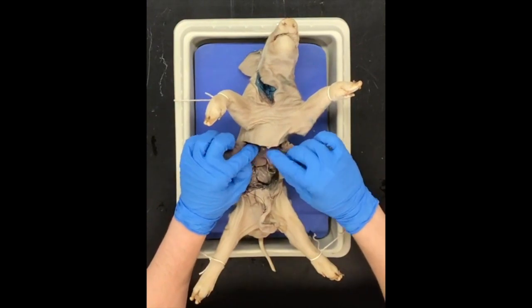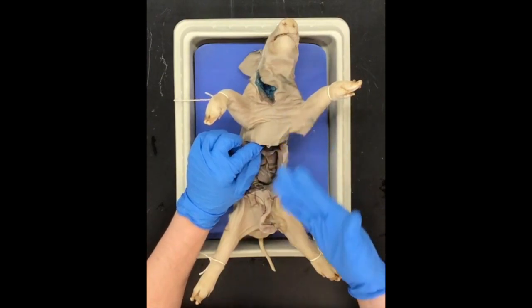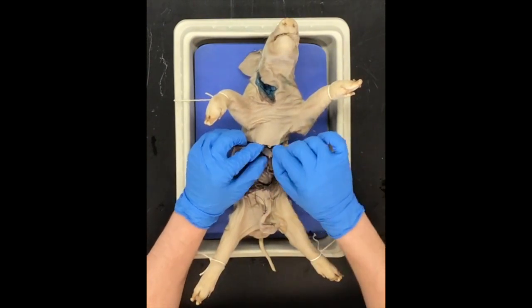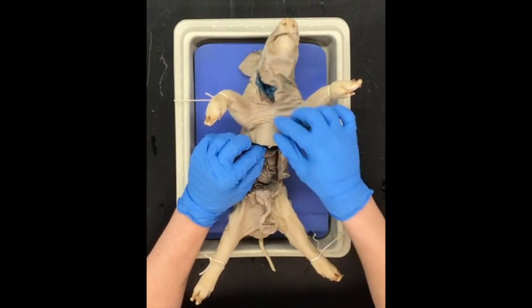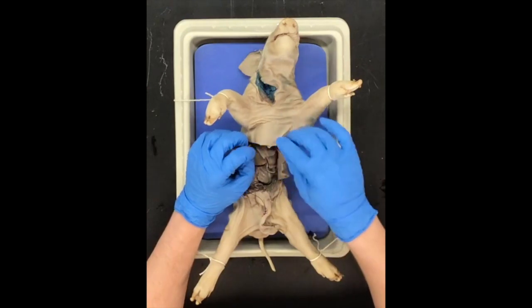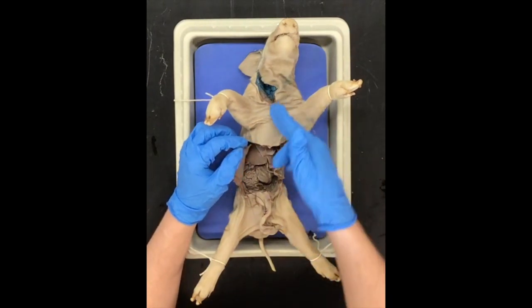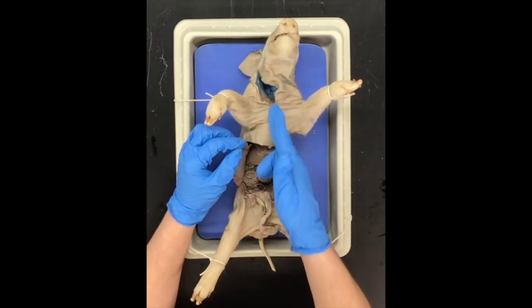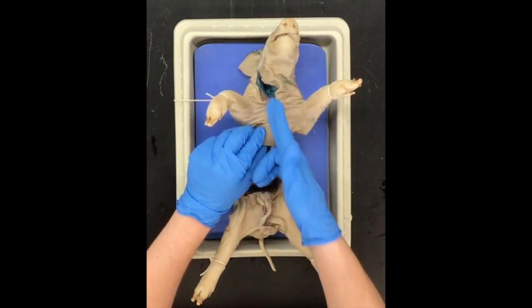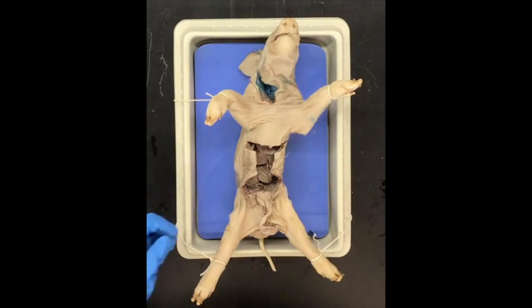This flap right here is called the diaphragm, and the diaphragm is the muscle that allows us to breathe — and would have allowed this pig to breathe. Basically, this is the structure that separates the chest cavity, or the thoracic cavity, from the abdominal cavity. So once we get up into here, we are now dealing with the rib cage and the sternum, which is this bone that protects the heart right in the middle of our chest. We're going to cut up through the chest cavity and try to separate that out.